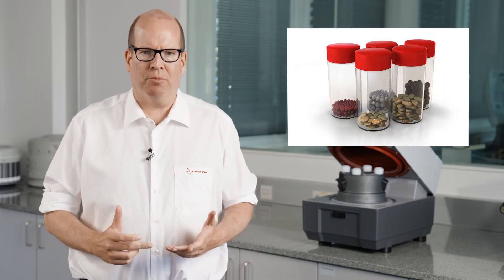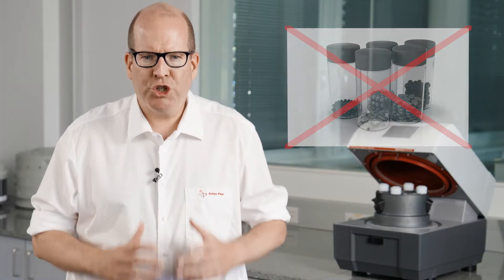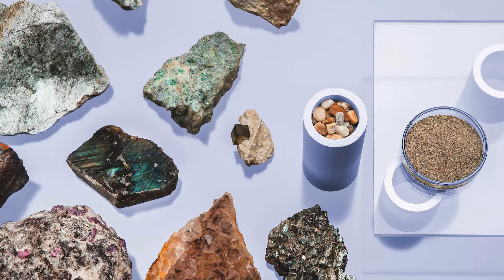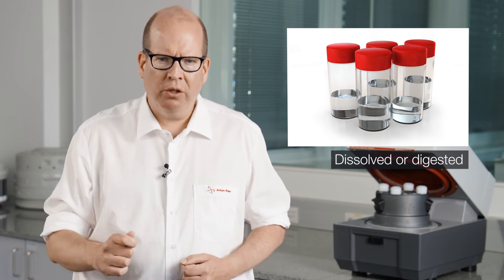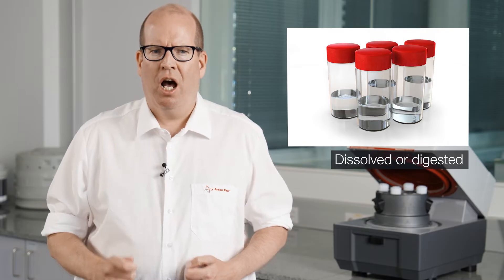Why do samples need to be prepared prior to ICP-MS analysis? Simply put, because the ICP instrument can't handle samples in solid form. Solid samples can range from food, pharmaceuticals, polymers, and metals to minerals, alloys, and petroleum. Whatever you want to analyze first needs to be prepared — that means dissolved or digested. The result is a clear, particle-free solution in which all analytes are in solution.